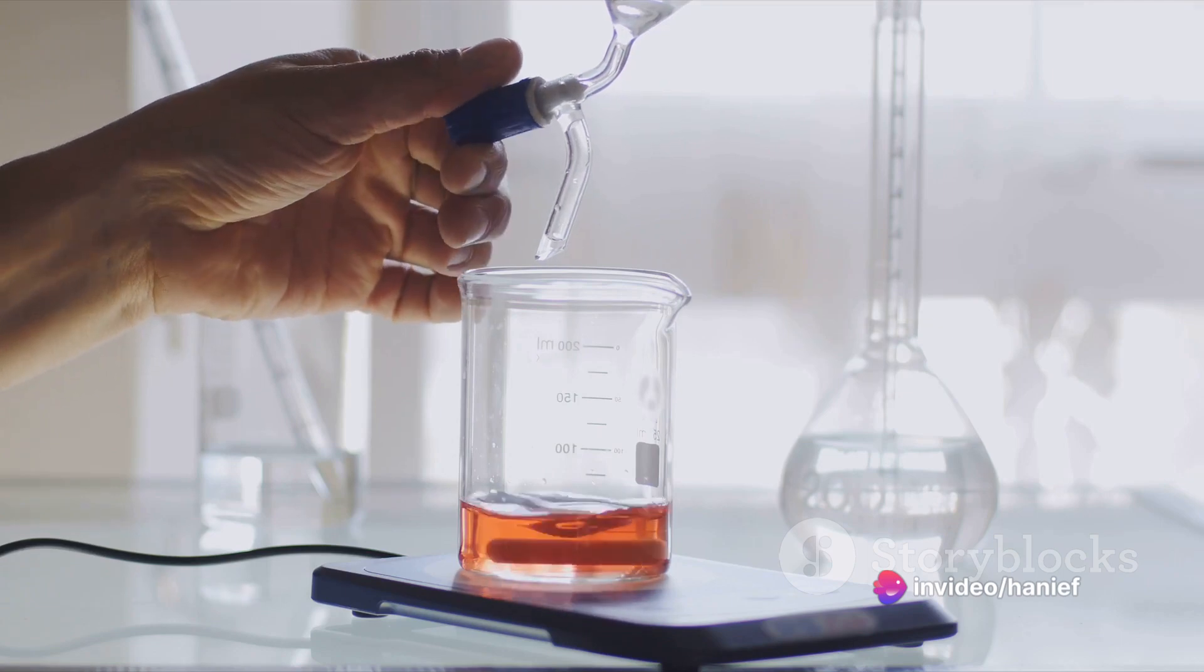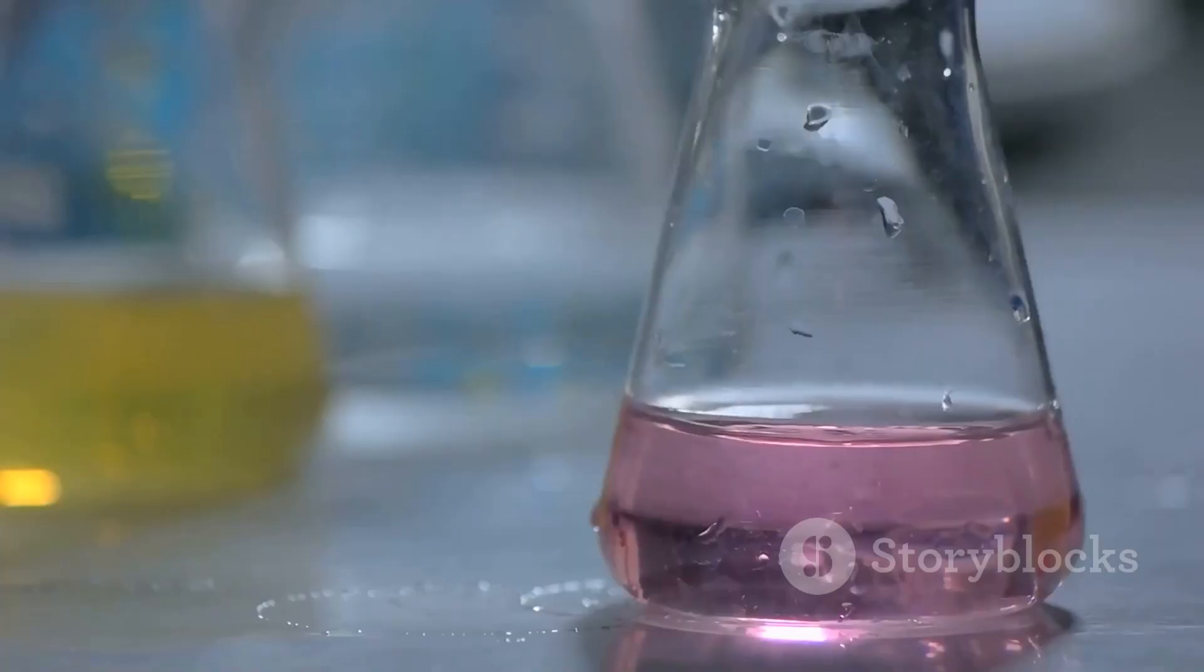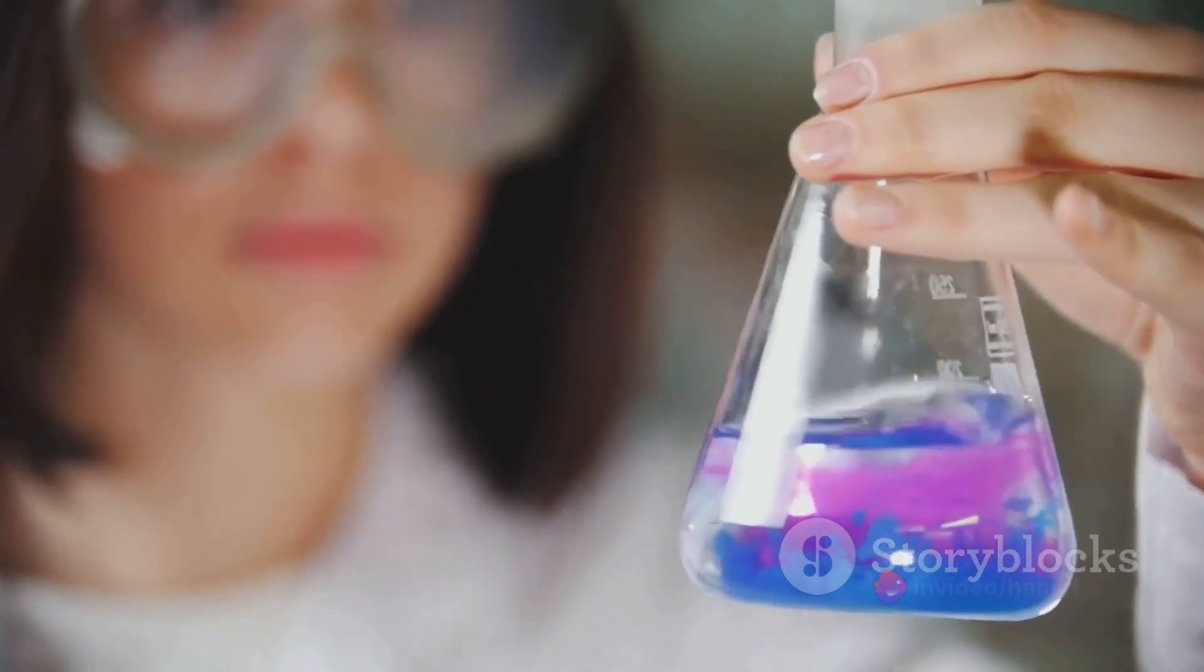The moment of magic happens when you're nearing the point where all the hydrochloric acid has been neutralized. This is the equivalence point. At this stage, the solution will quickly turn from colorless to a faint pink as the environment within the flask becomes slightly basic.